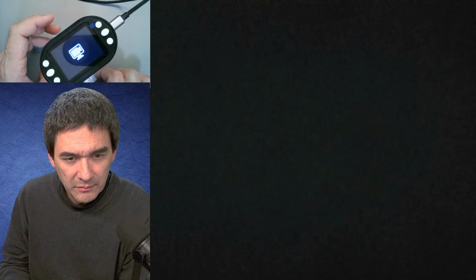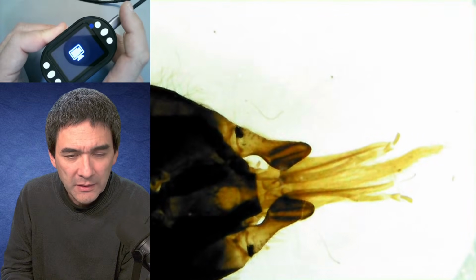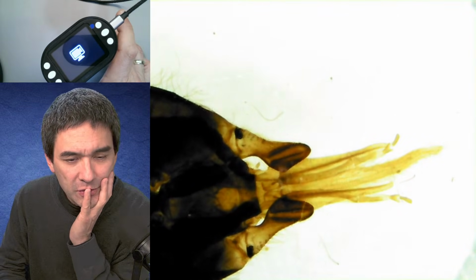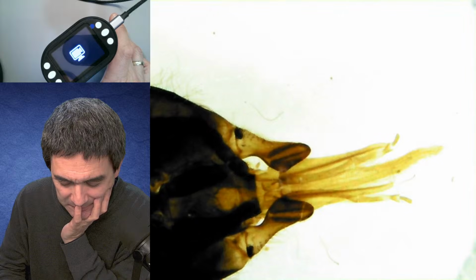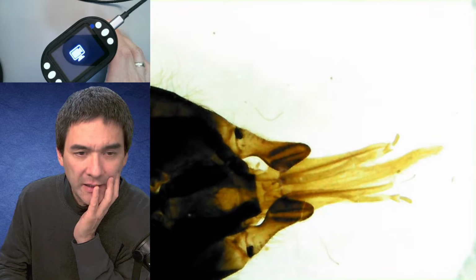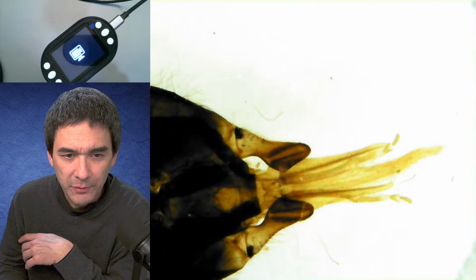So what I have to do, that actually shows a little bit the problems that we have with this. Yeah, and here we are again. So you see that there are some reliability issues, but let's go back to a slightly lower magnification. Those devices are a nice idea, but the connection is not quite as stable. And if I turn up the light all the way again, I'm kind of worried that it will disconnect again because it simply takes in too much electricity from the USB.